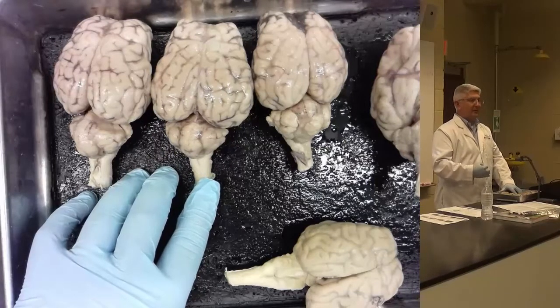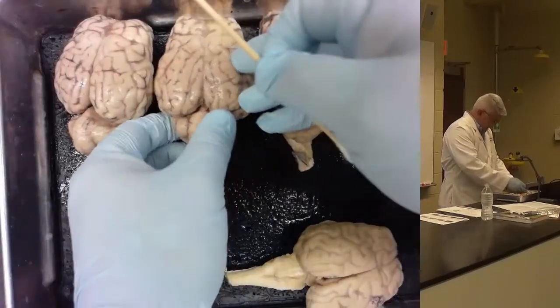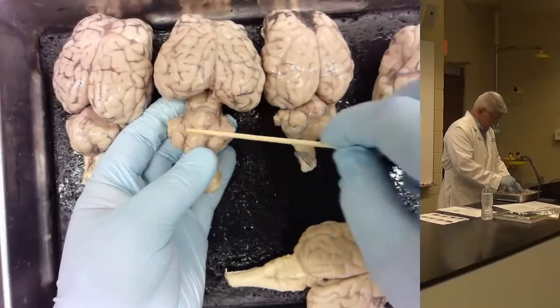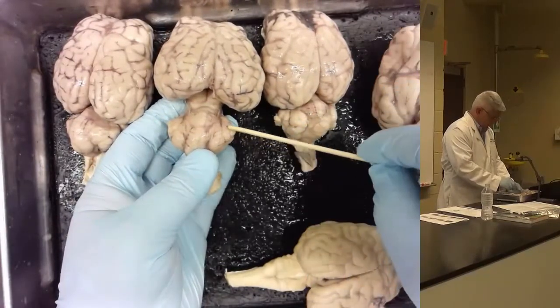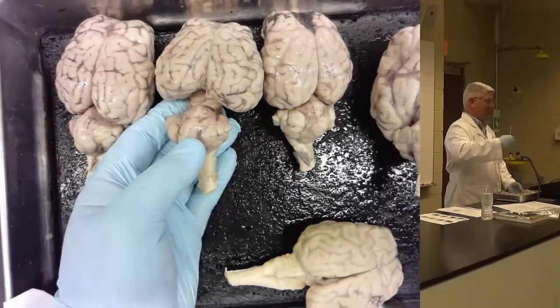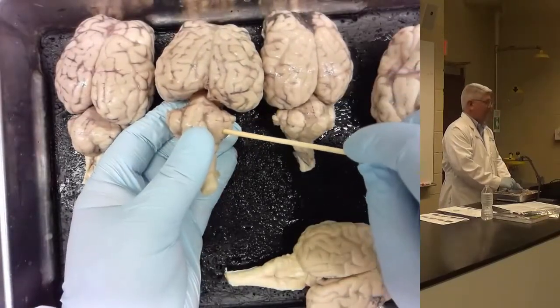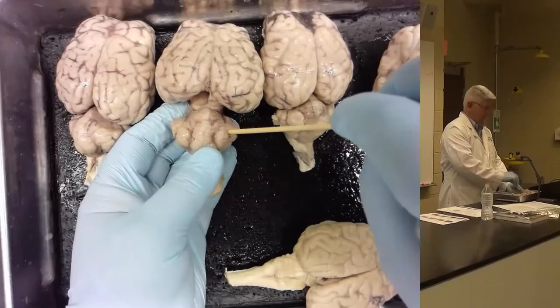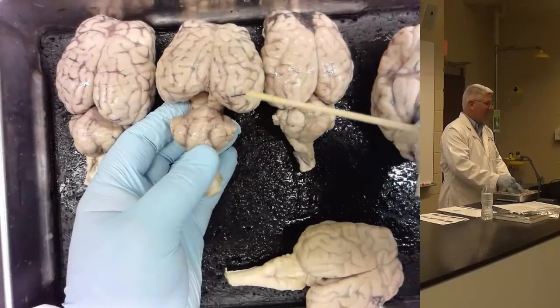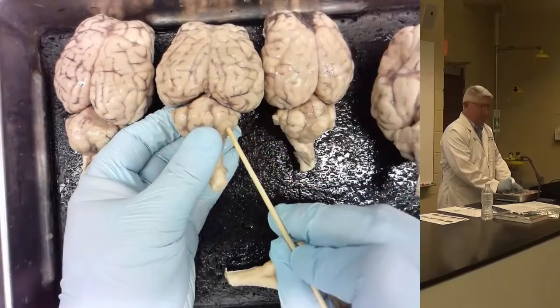What separates the anterior and posterior lobes of the cerebellum is the fissure prima. The fissure prima is a little bit hard to see. It runs around here. It's usually easiest to see running through the vermis. And that separates one-third from two-thirds, anterior, posterior. Anterior lobe, posterior lobe. Okay? I'm not going to put a pin here and say, what lobe of the cerebellum is that? I won't do it, I promise you. It'll either be anterior, in front of the fissure prima, or posterior, behind the fissure prima.